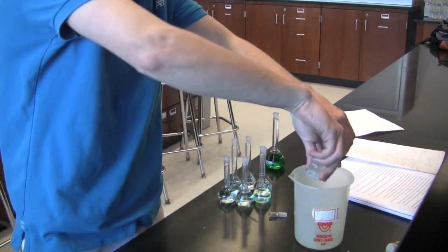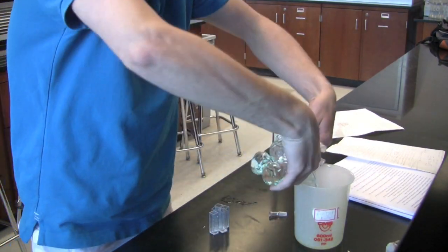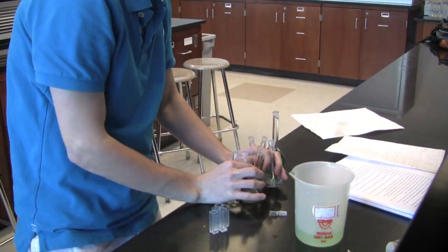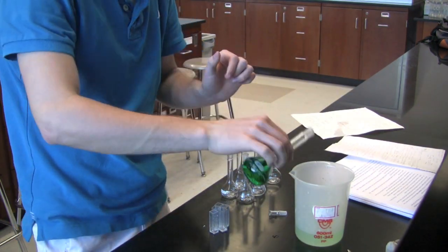Now it's time to clean up. Take your cuvettes and your diluted solutions and your stock solution and dump these all into your waste beaker.